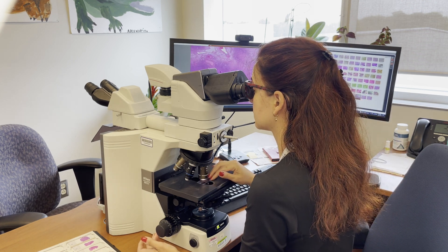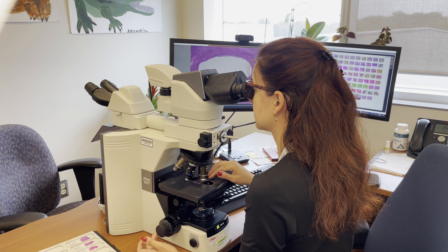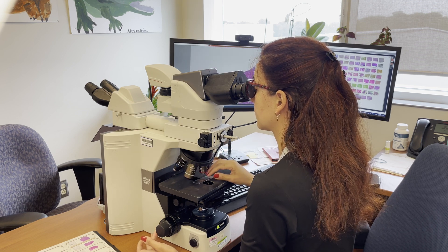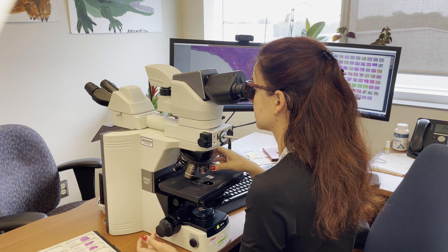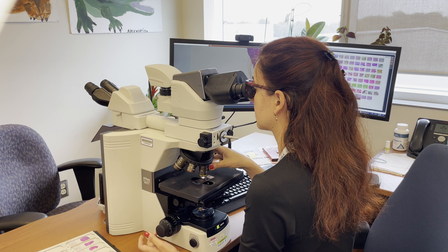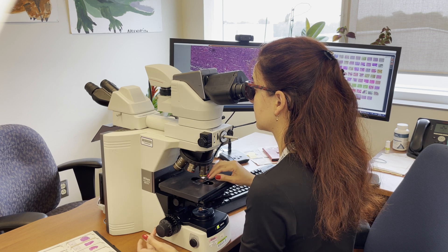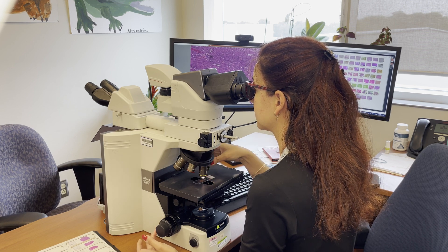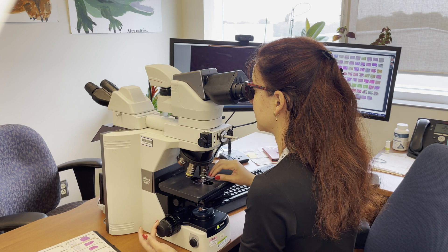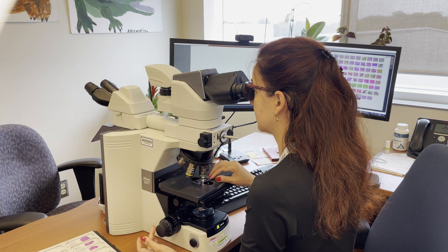Next, the glass slides are sent to a pathologist who performs a microscopic examination of the tissue. A pathologist is a specialist medical doctor trained to analyze tissue and to combine those results with other information about the patient in order to reach a final diagnosis.